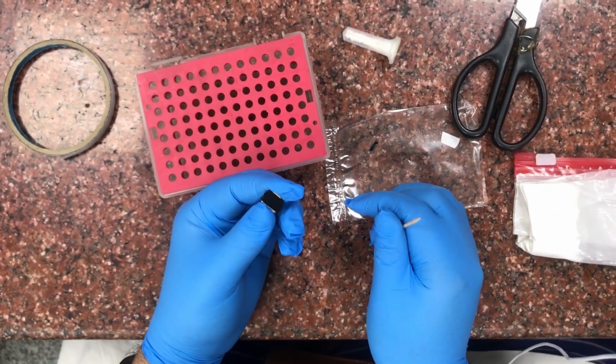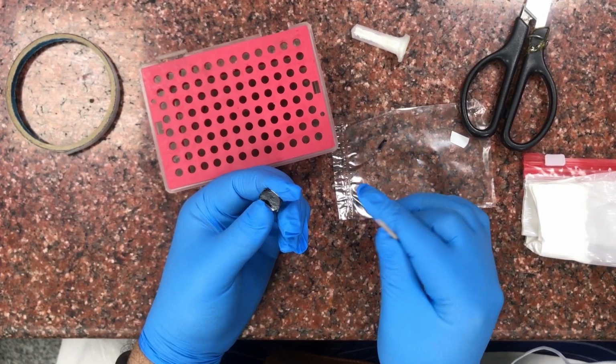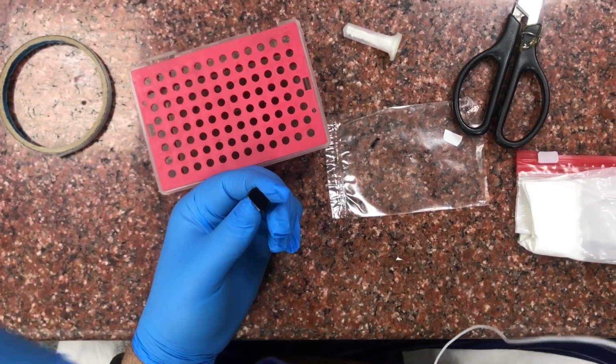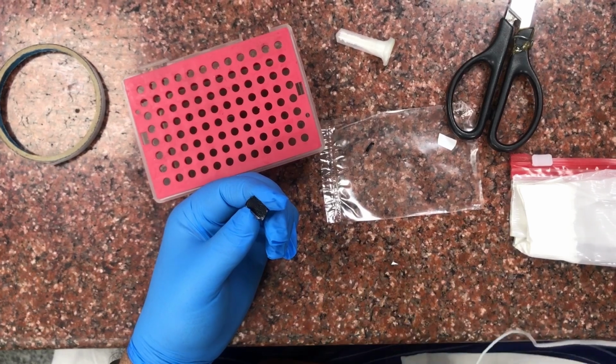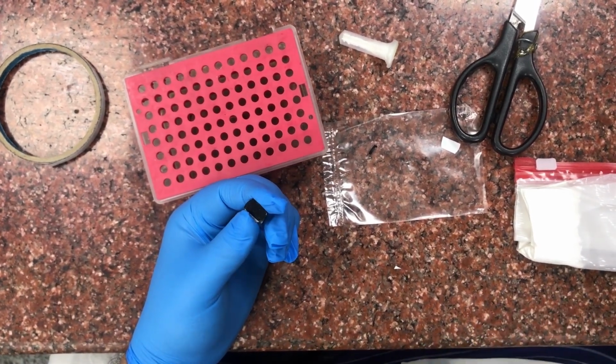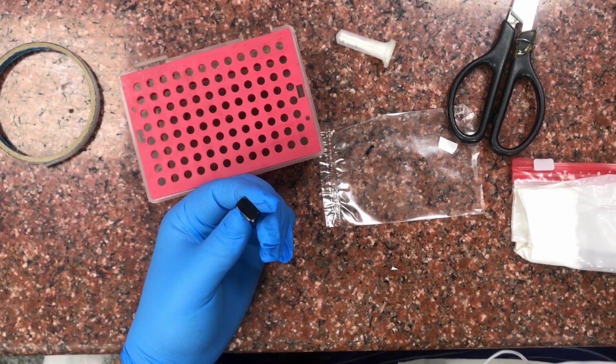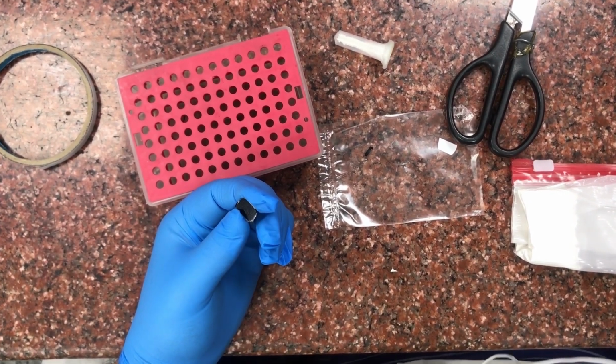This is a carbon tape, and it's carbon because carbon is conductive. So as we gold coat something, we will make sure that when the gold coat comes to the carbon, the conduction is transferred from the stub to the machine, so that it creates a full circuit, and that's very important for this thing to happen properly without any charging effects.